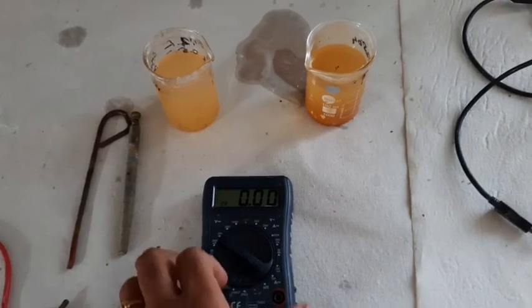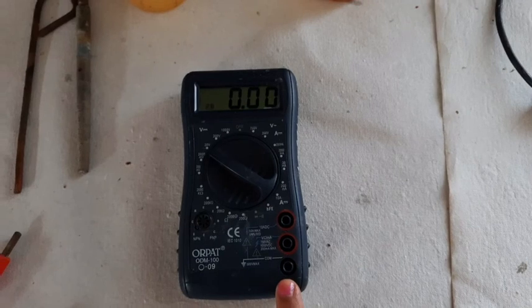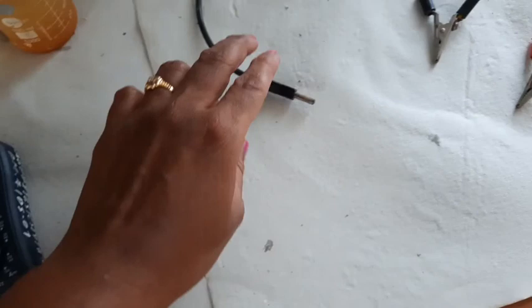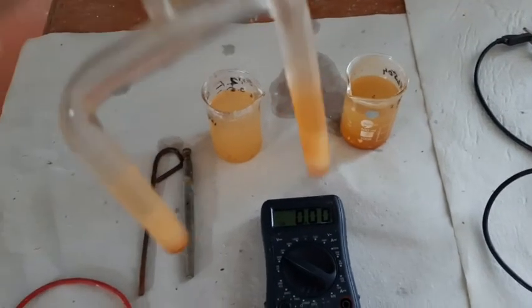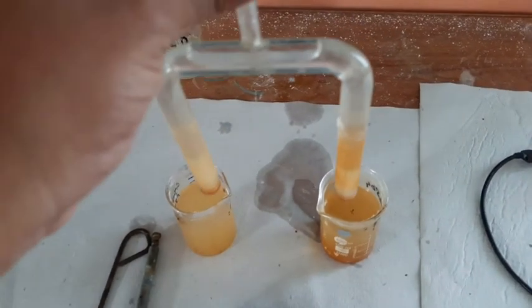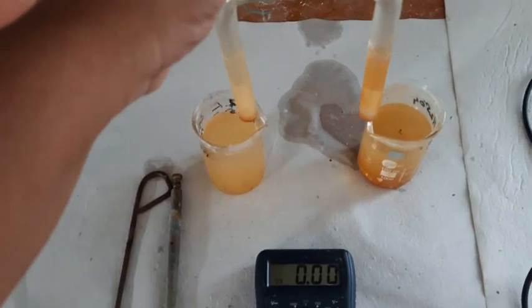A multimeter is used here as a voltmeter. Connecting wires are required for this experiment. A salt bridge — an inverted U-shaped glass tube filled with agar-agar gel — transfers ions from one cell to the other. Now we are going to set up the equipment.